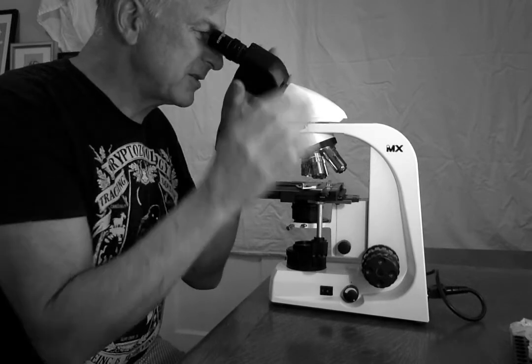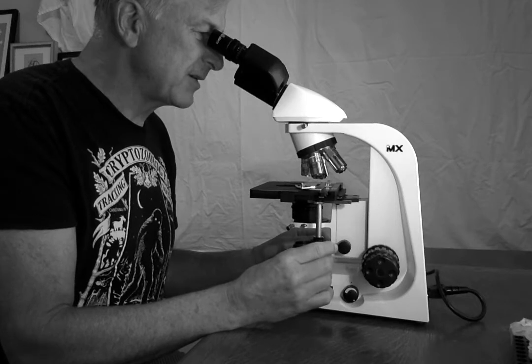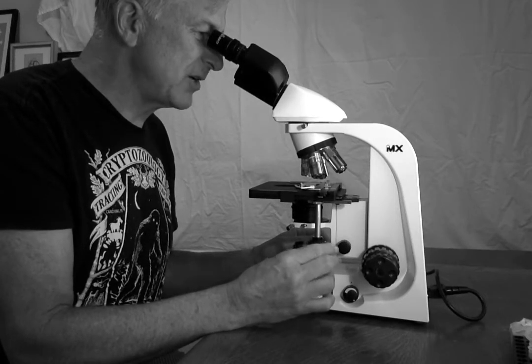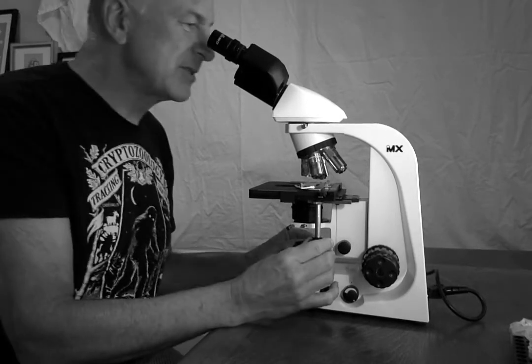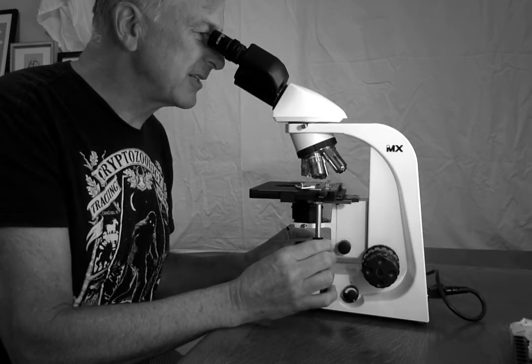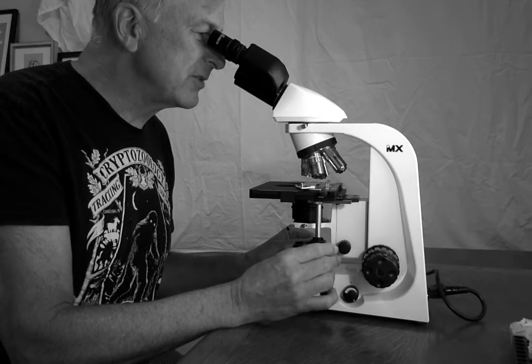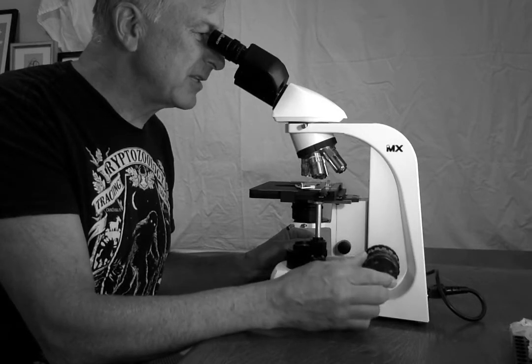So I'm going back to my sample. I'm going to play around, and I'm going to search and explore using the stage adjustment knobs. I'm going to move up and back and around until I say, oh, that is really interesting. Then I am going to focus a little more on what I think looks interesting.